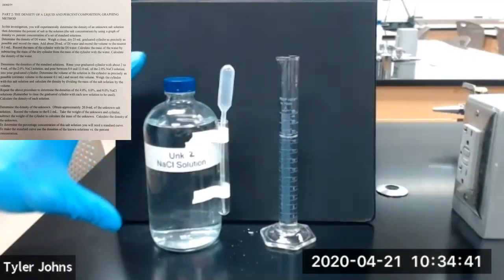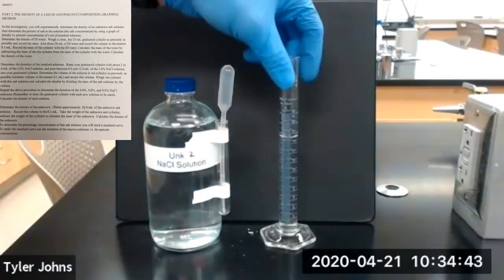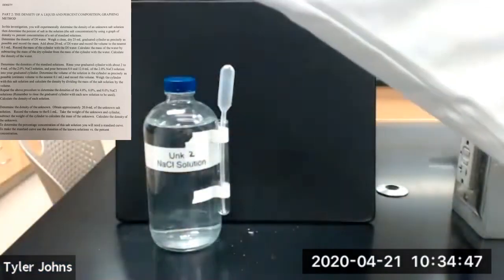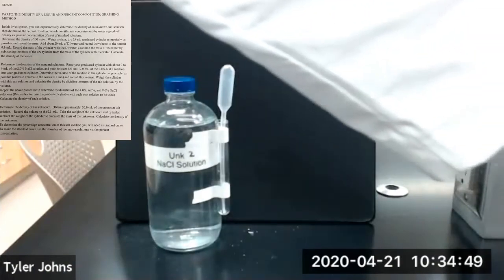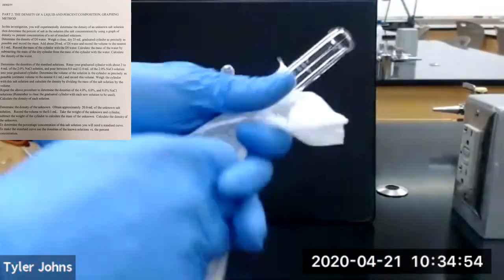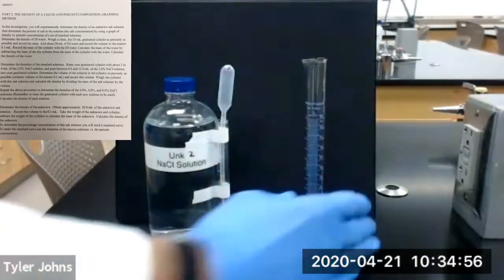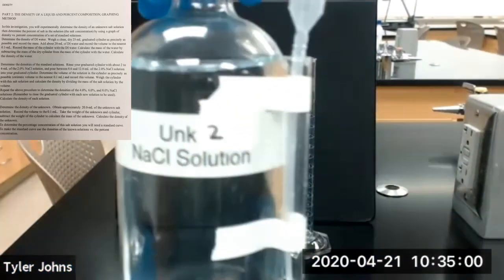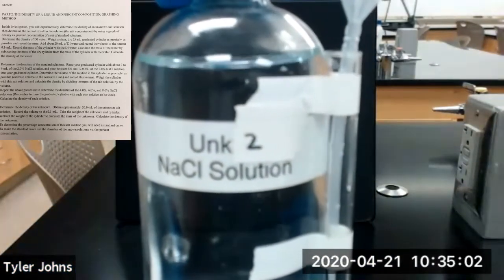Okay, so we're going to move on to our second unknown salt solution. So we're going to dump the remaining unknown salt solution number 1. This is our unknown salt solution number 2.